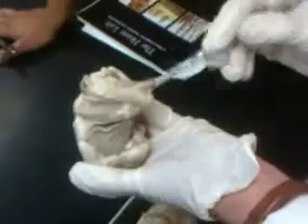If you look at the vessels coming right out of here, that would be? Coming out of here — pulmonary trunk, right. So this would be? Pulmonary trunk. This is going to be the aorta.